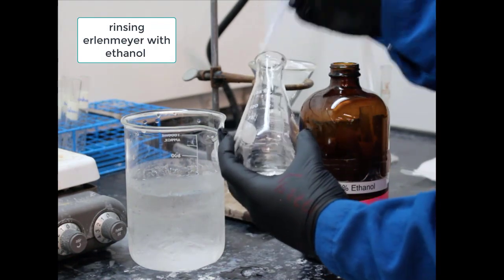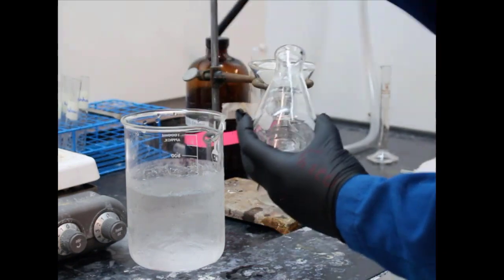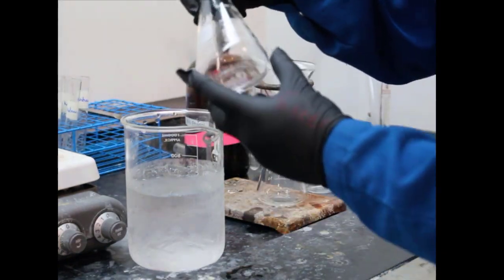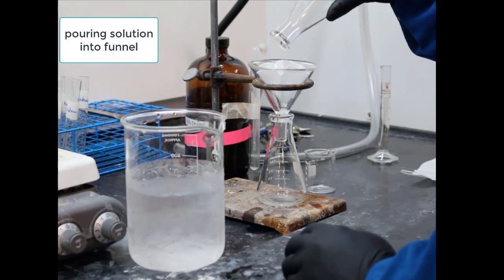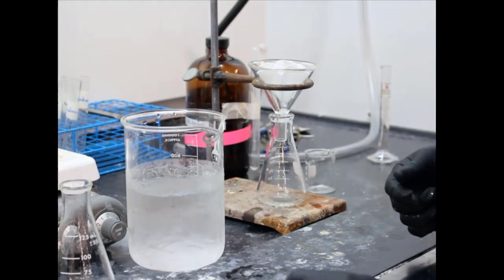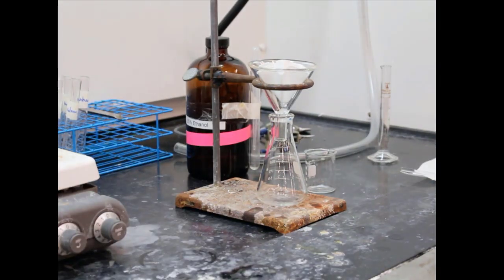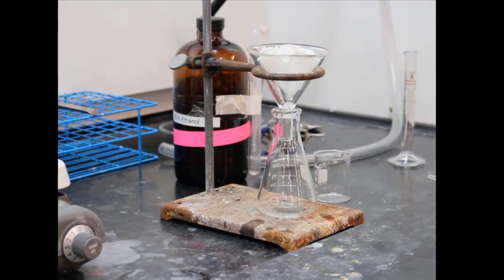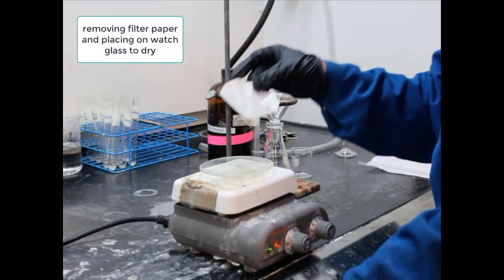Now, what would have been better than using room temperature ethanol is if they had an extra beaker of ethanol set aside in cold water in the ice bath. Some of the solid stuck to the Erlenmeyer could have redissolved, and they wouldn't have as accurate a mass reading for their final product that gets caught in the filter paper.